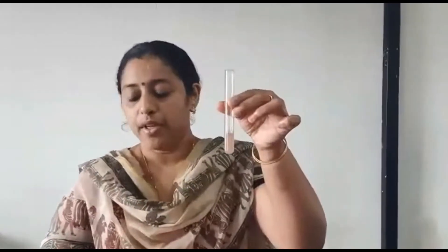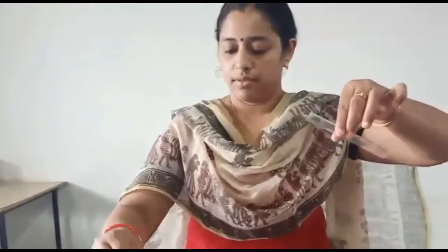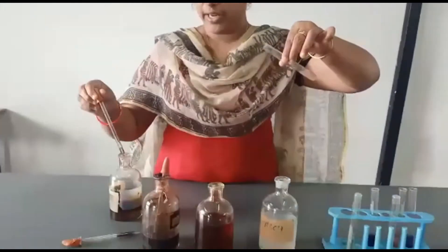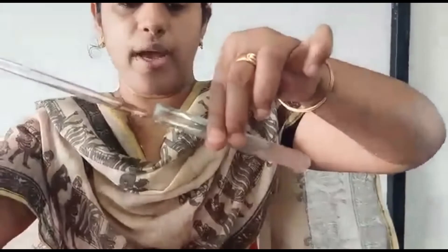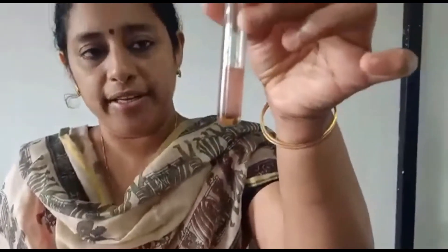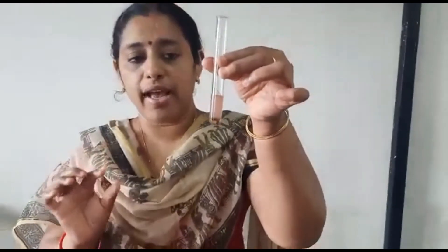Now you will notice a light brown color. In this, we have to add concentrated H2SO4. How to add this concentrated H2SO4 is very important. First, you have to keep the test tube in a slanting position, then you have to add the concentrated H2SO4 with help of a dropper. Now continuously you have to add this concentrated H2SO4 — this is concentrated, that's why the fumes are coming out. Now after adding concentrated H2SO4, place the test tube in a straight position. You can find one brown colored ring. You have to handle the ring very carefully — if you shake it too much, the ring will break. So this is the Ring Test, and it is another confirmatory test for starch.